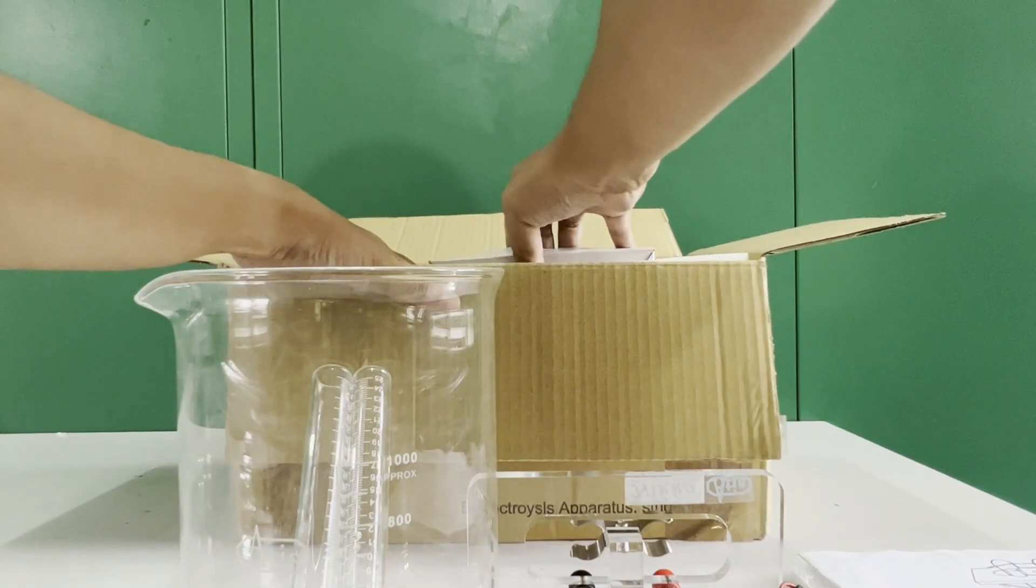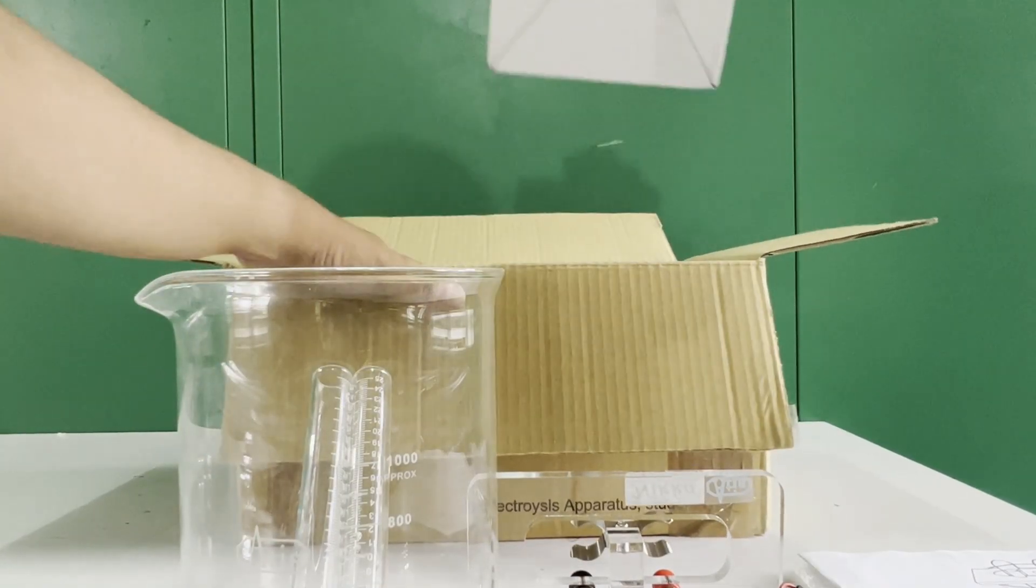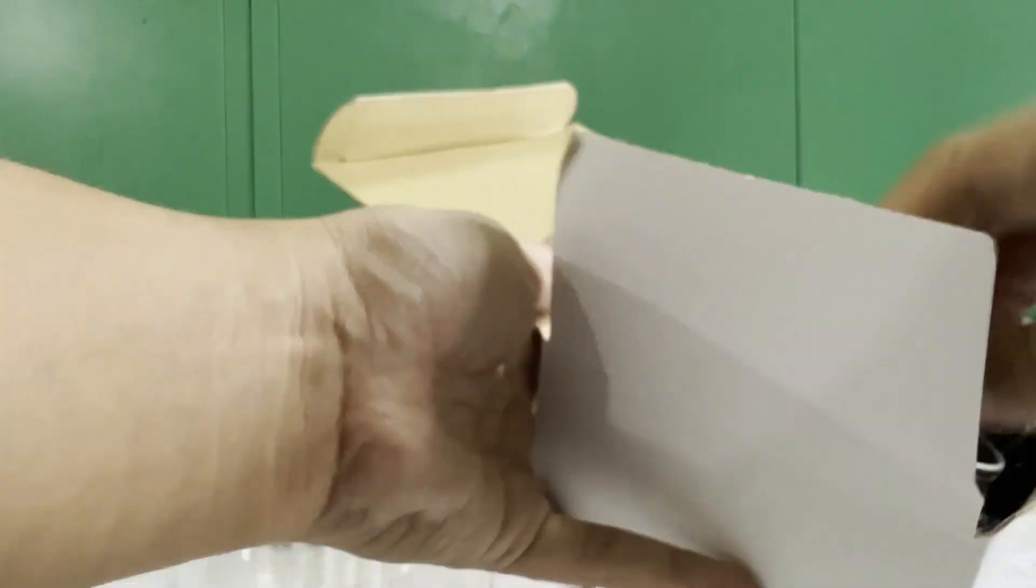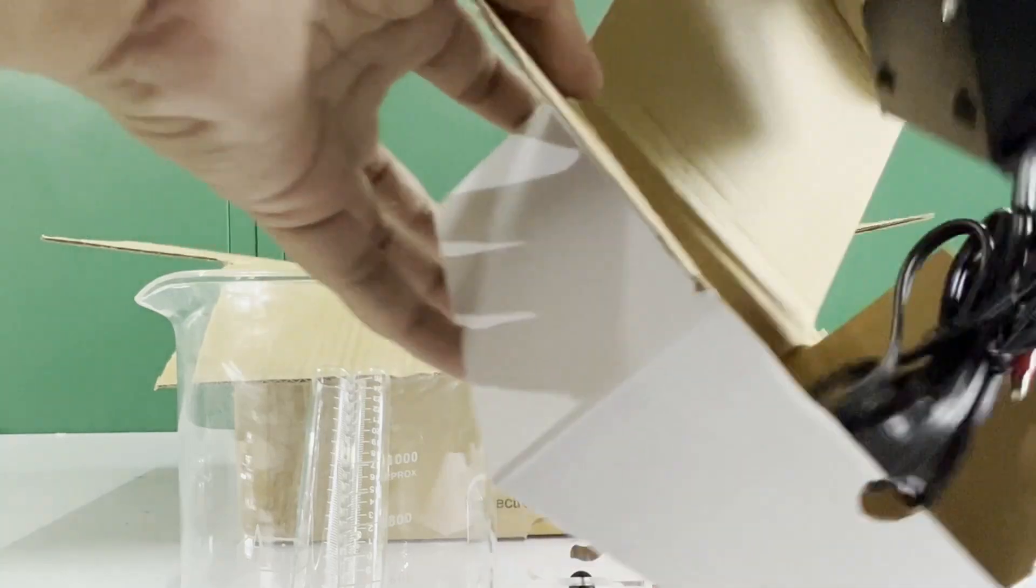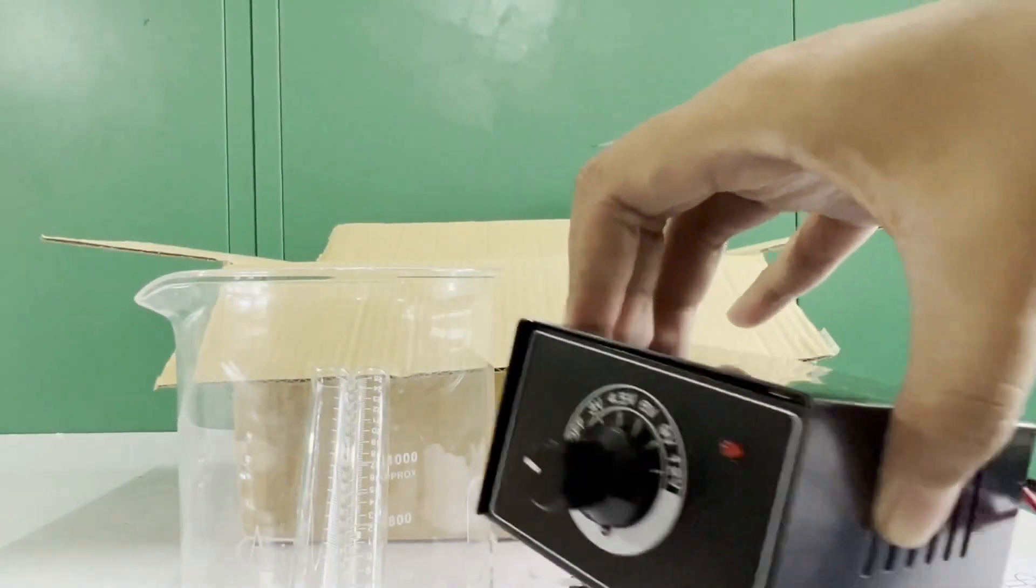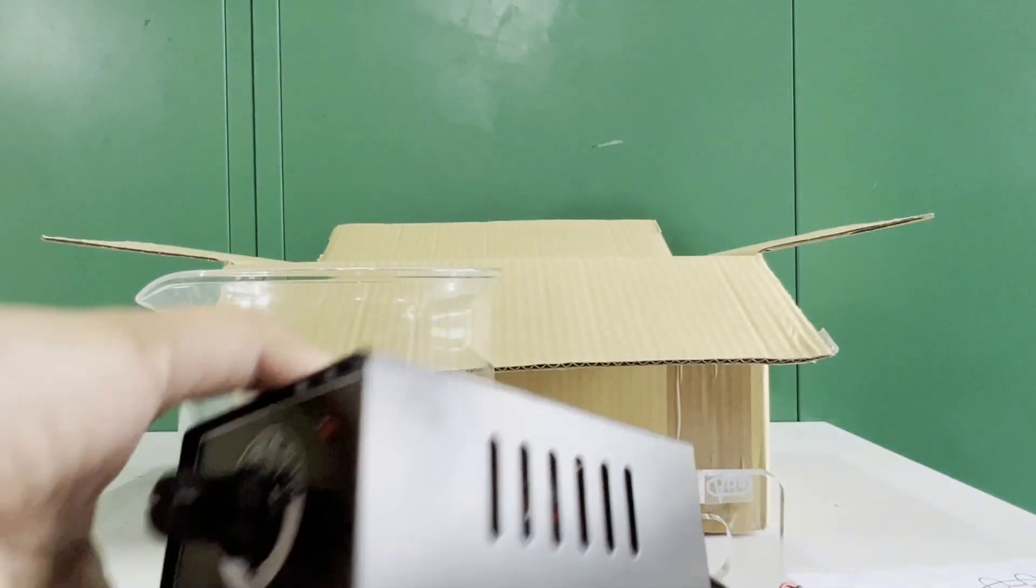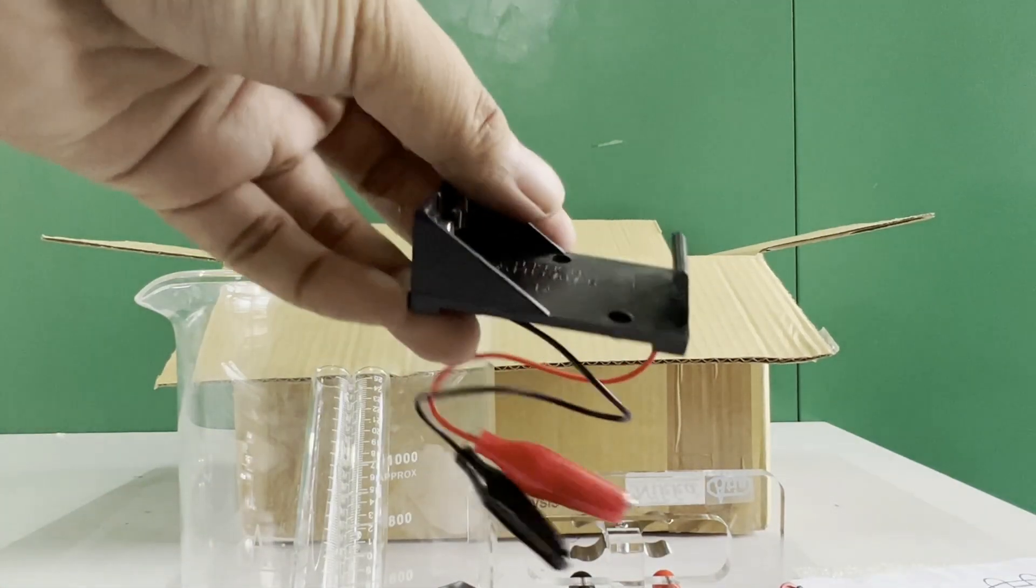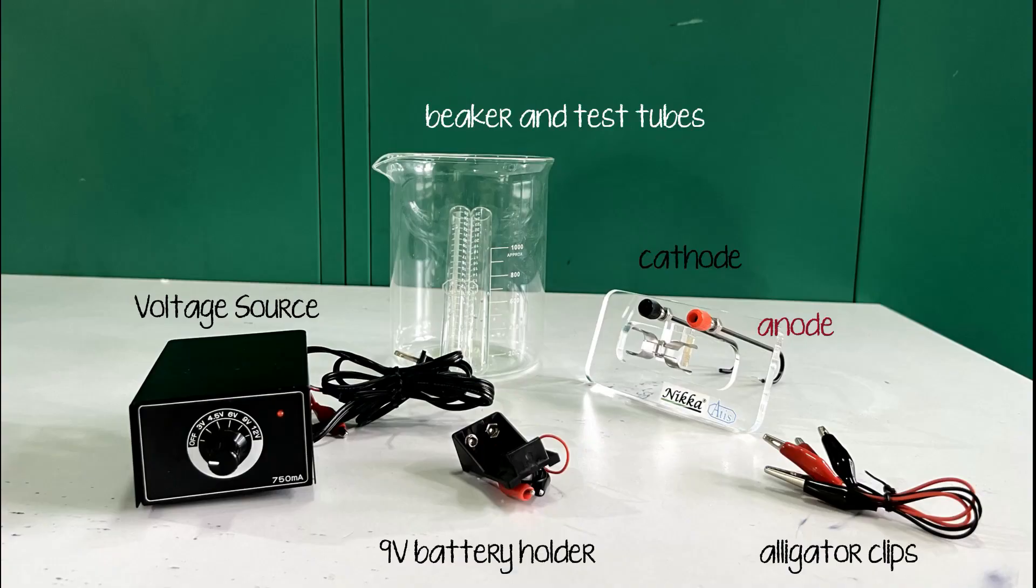Connectors with alligator clips, an external voltage source, and a 9V battery holder. However, in this experiment, we will be using the external voltage source.